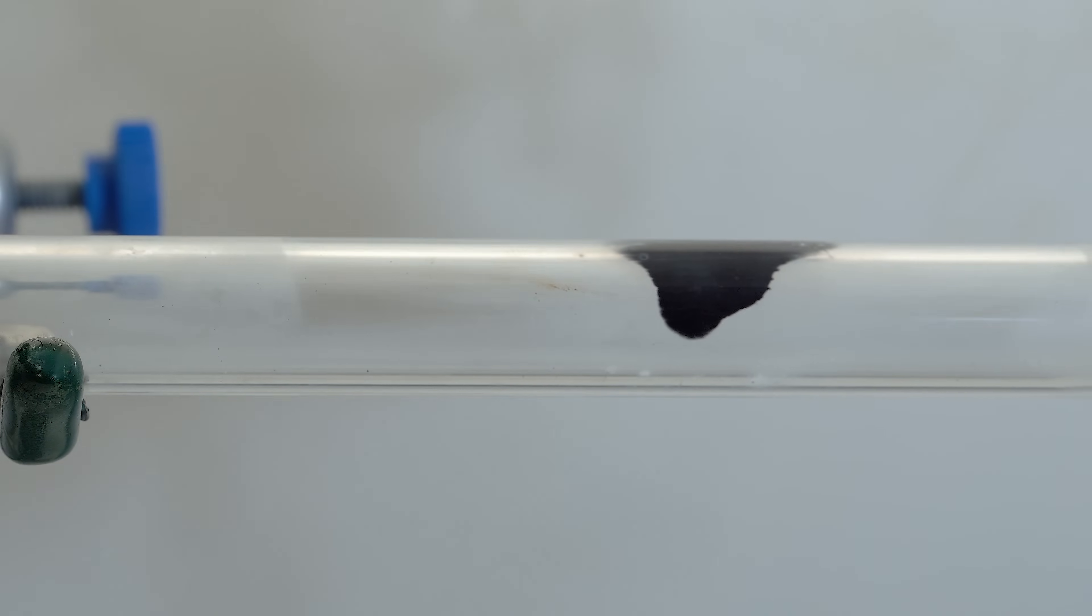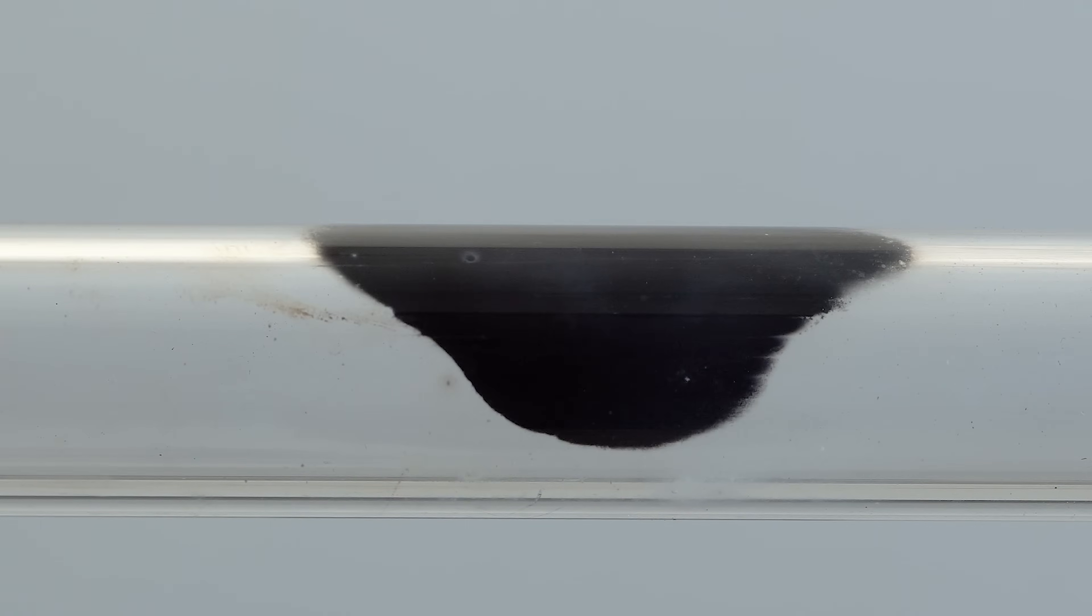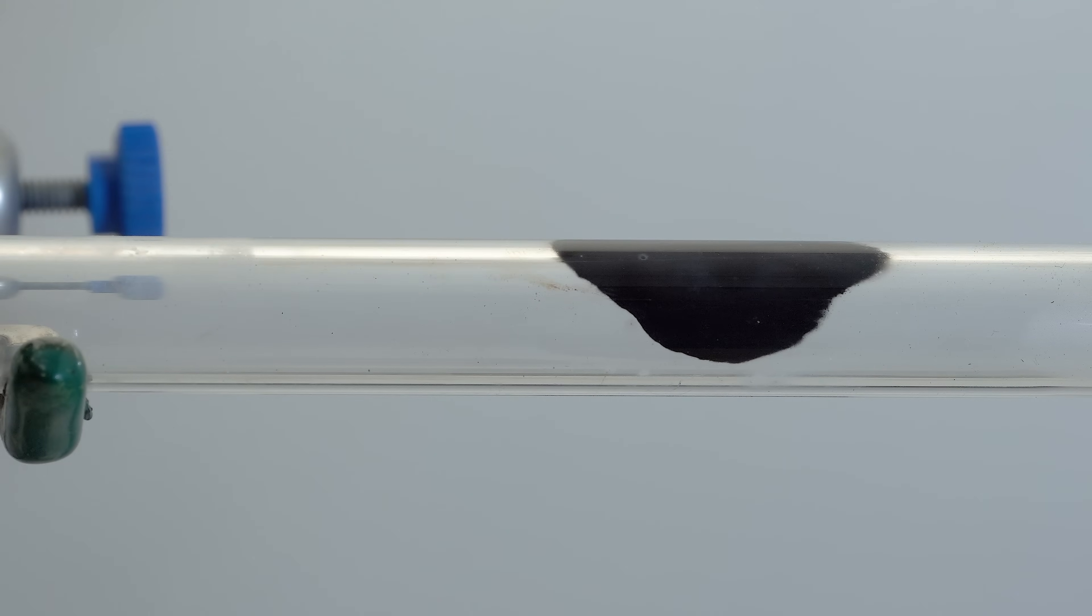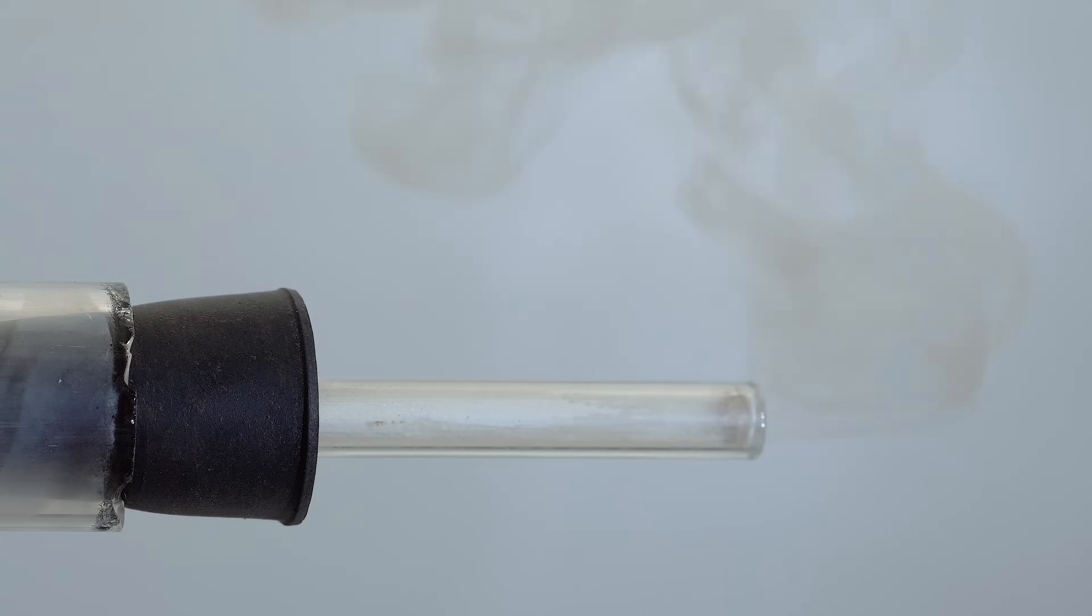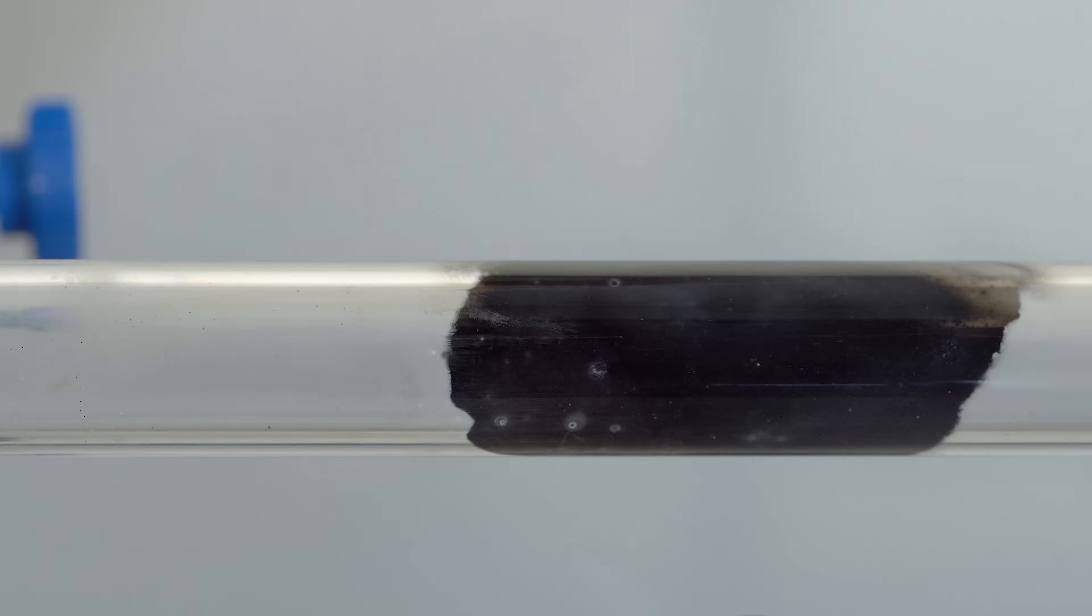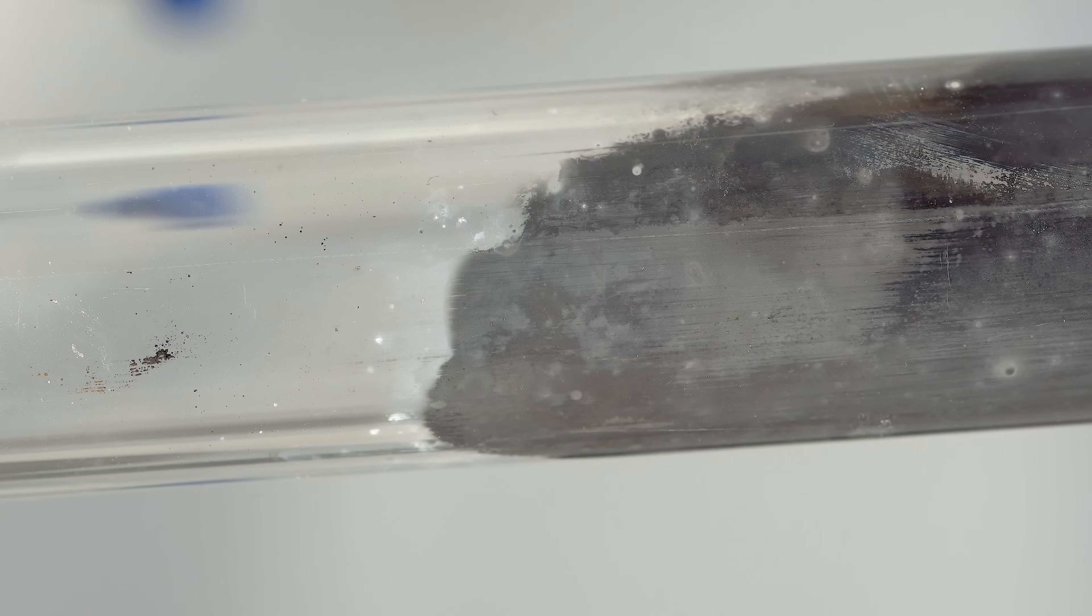Unlike the reaction with tungsten hexachloride, there are minimal side reactions here, so you will not see any blue smoke, as you did with tungsten hexachloride. Very high-quality tungsten coating deposition from tungsten hexafluoride makes this method the preferred choice among the three compounds in industrial applications.